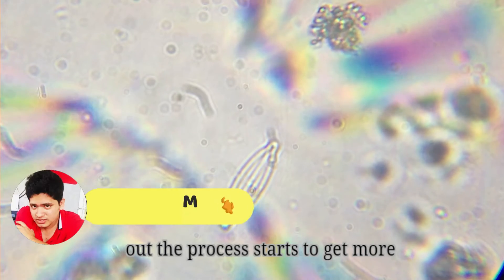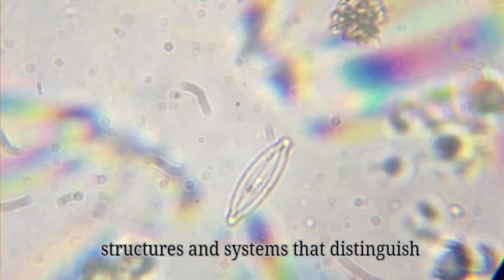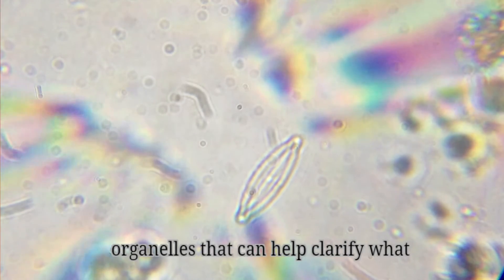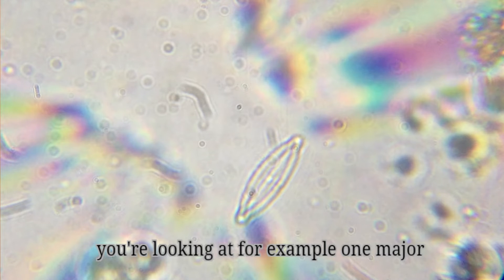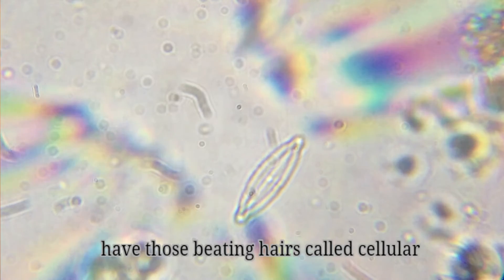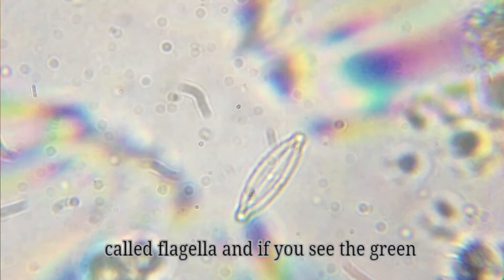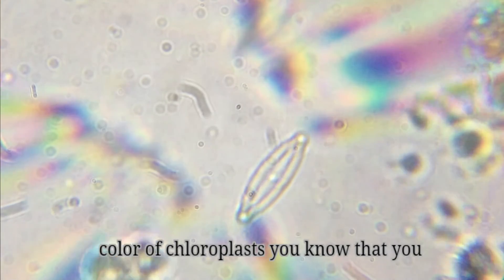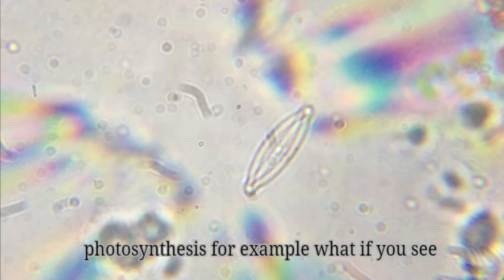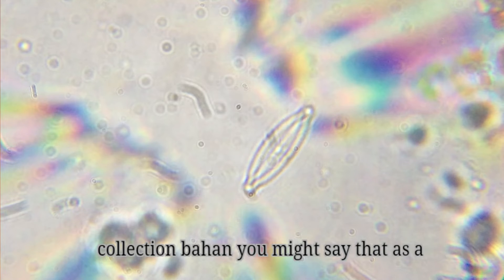With single-celled eukaryotes, the process starts to get more difficult. You won't see the complex structures and systems that distinguish multicellular organisms, but you will see organelles that can help clarify what you're looking at. For example, one major clue can be picking out which organisms have those beating hairs called cilia versus which ones have more whip-like hairs called flagella. And if you see the green color of chloroplasts, you know that you need to find an organism capable of photosynthesis.